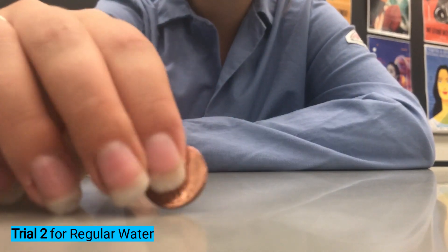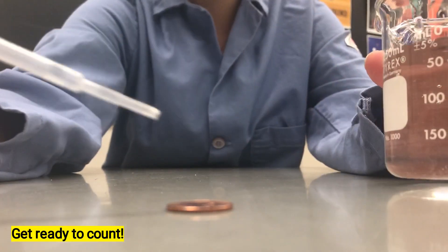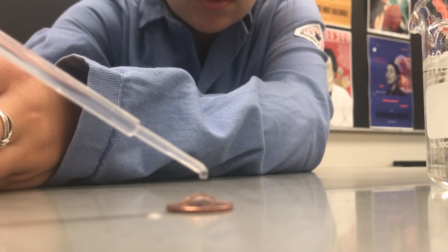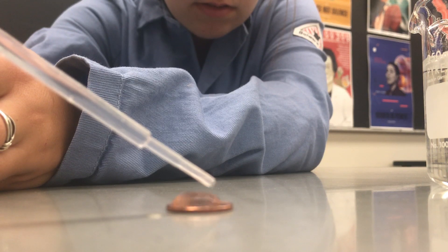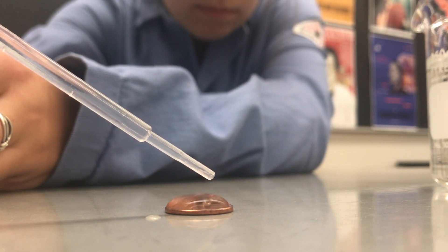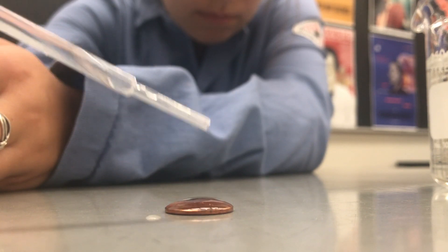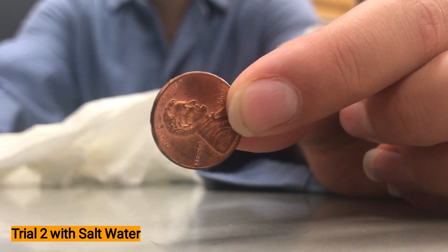Here we are beginning trial two with our water. Again placing it onto the head side of our penny, taking my water, counting how many drops I can get. I'm recording my data, and here we are beginning trial two with the salt.